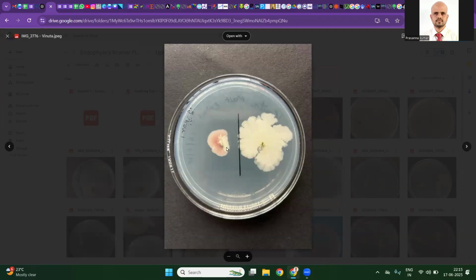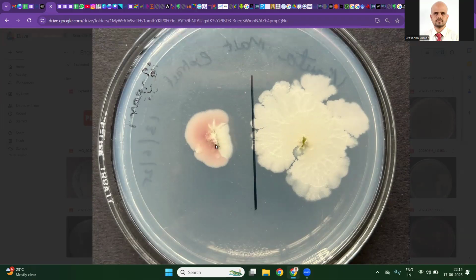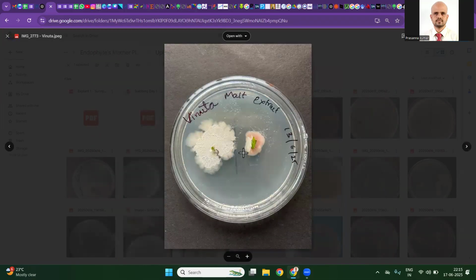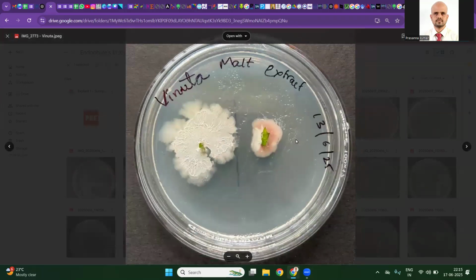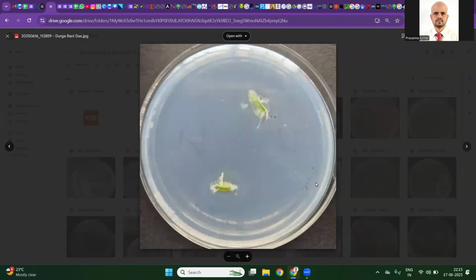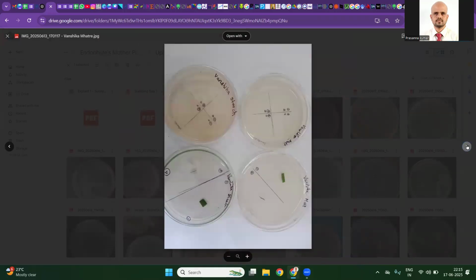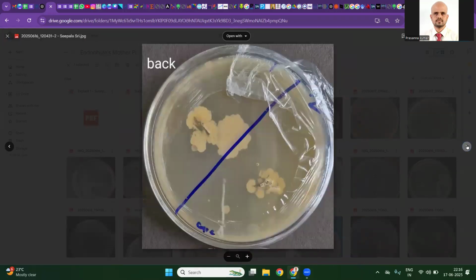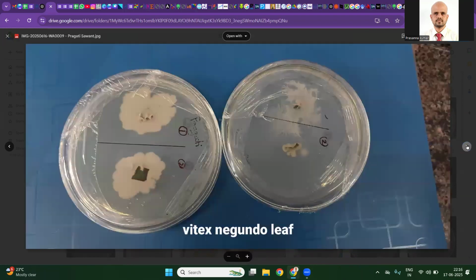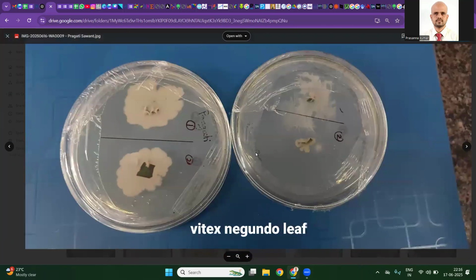Even though there are two different bacteria, the pigmentation on the reverse plate clearly shows there are two different morphotypes. So both can be sampled, this bacteria and this bacteria, and we can go for pure culturing. Here also, if the imprints are clean, this could be a potential endophyte. Imprints should be cleaner. Front and back pictures are shared here. Oh, that's good. The imprint plates are clean again. This could be an endophyte.